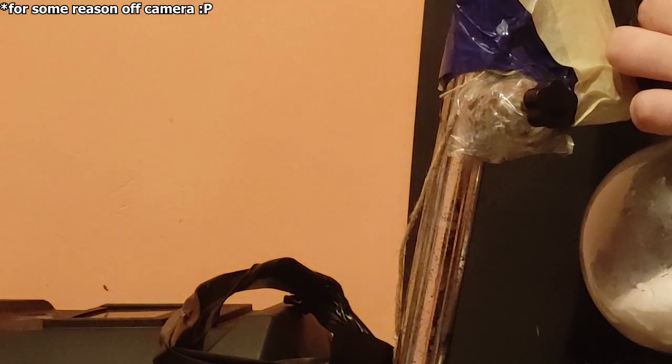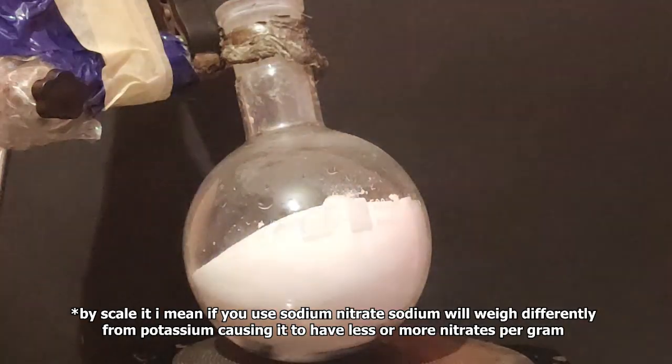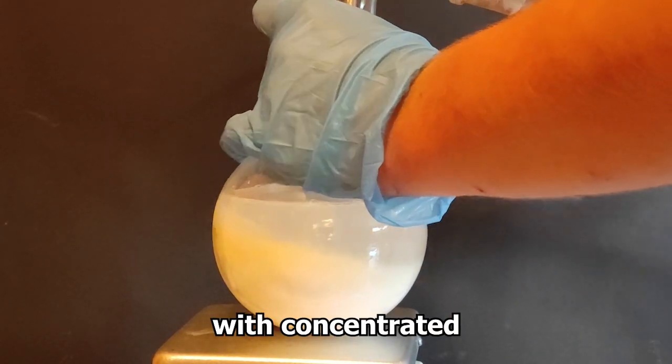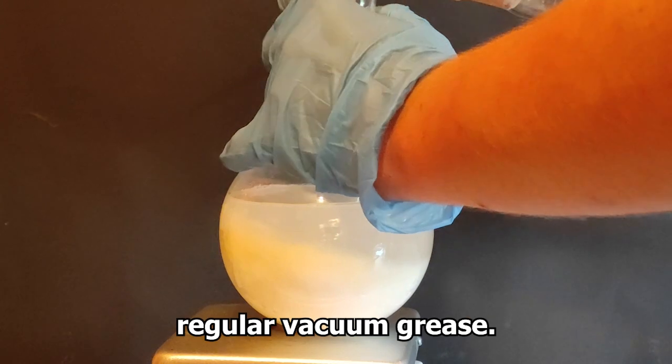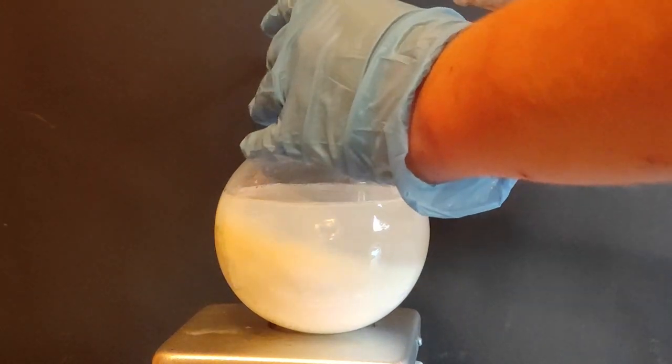340 grams of potassium nitrate was added to the round bottom flask. You can use any type of nitrate, but you may want to scale it accordingly. After which every joint was sealed with concentrated sulfuric acid. You can't use regular vacuum grease because the nitric acid will eat right through it.